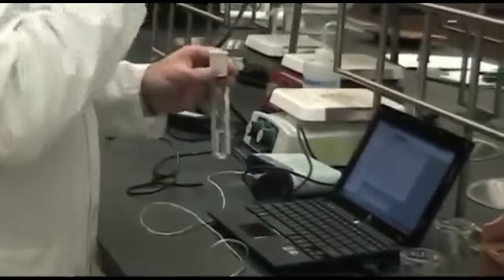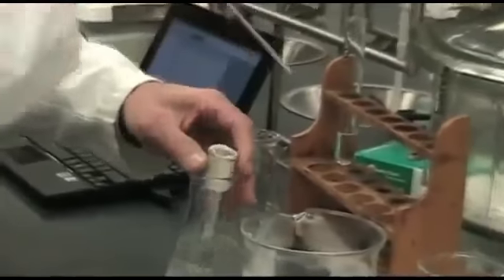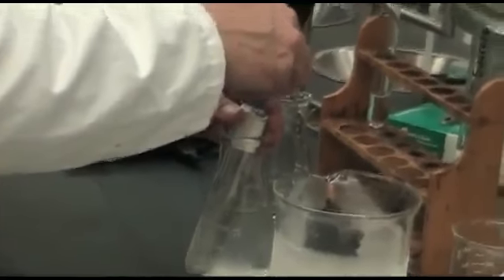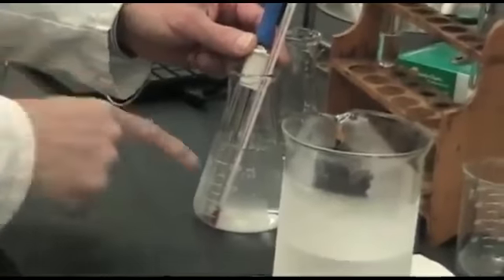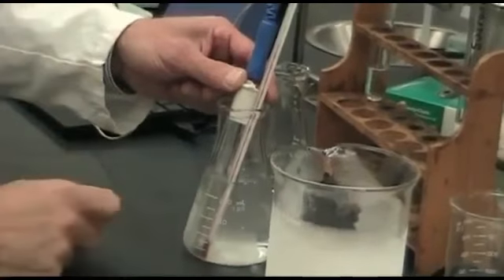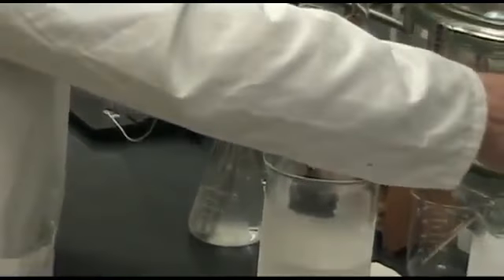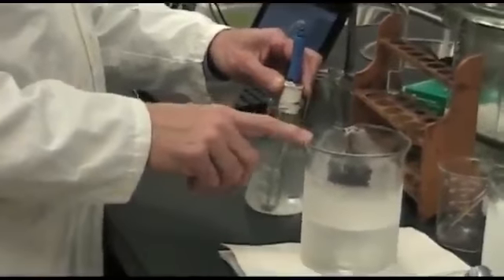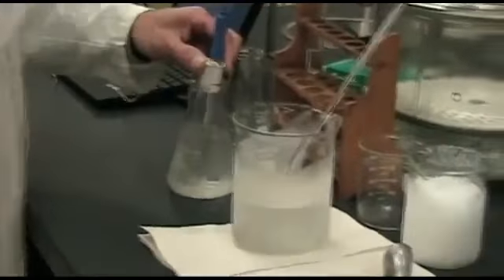And we start our data logging device, and we will put it in there, and it's going to take a bit of time. We're going to monitor the temperature of the ethanol solution so that it stays cold enough. And then we have some spare at -40 degrees, and we can monitor that. So if it gets too warm, then we can always put in more dry ice that I have ready right there.